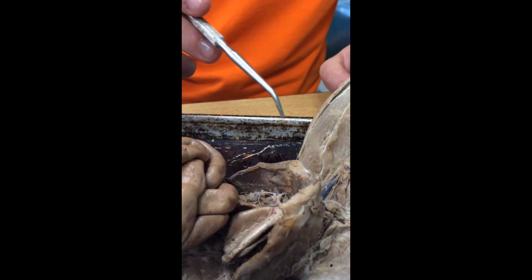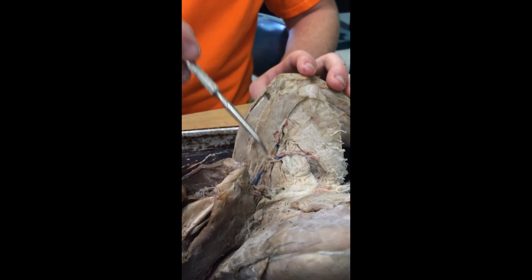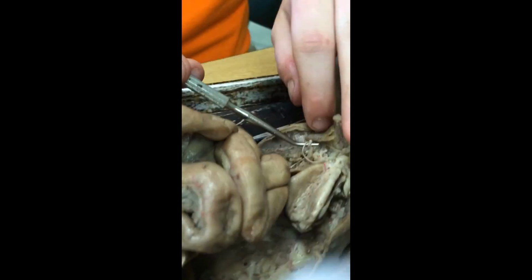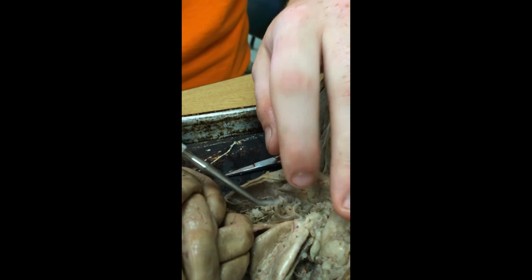Unfortunately, we do not have most of it. We do not have the glands, penis, the testes, or the epididymis because they were all cut off because this cat was neutered. However, we do have the vas deferens, or in cats, it's known as the ductus deferens. And that is everything. Thank you very much.